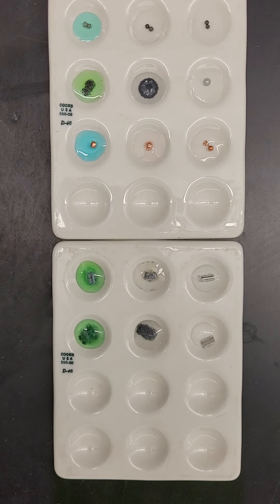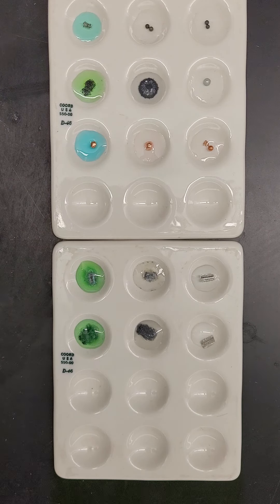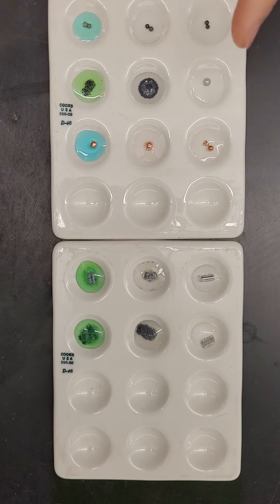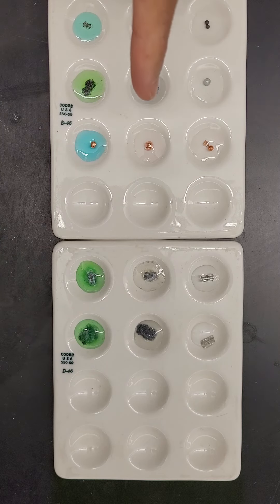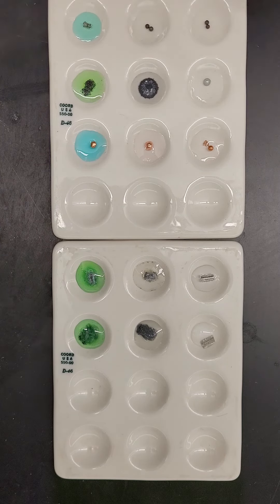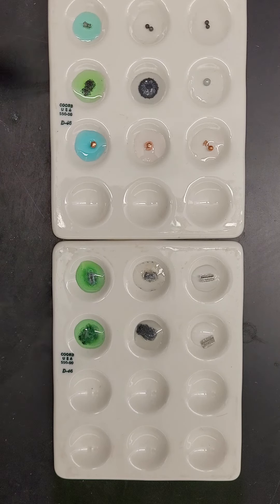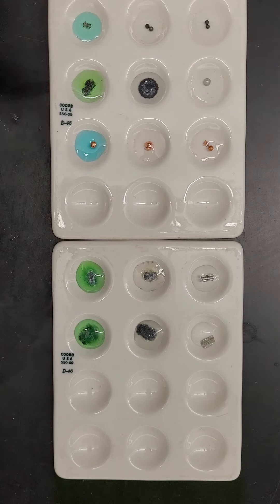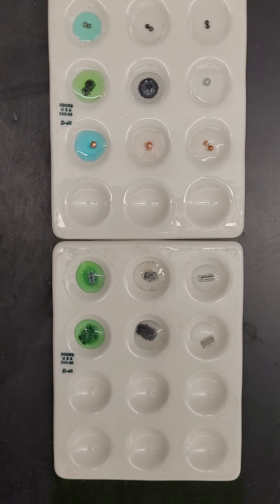The third column contains our copper pieces. Zinc nitrate has no noticeable change. The middle row with lead nitrate doesn't seem like there's any change — it just looks wet. The third one, with copper nitrate, I would say the same — there's really no noticeable change there either.